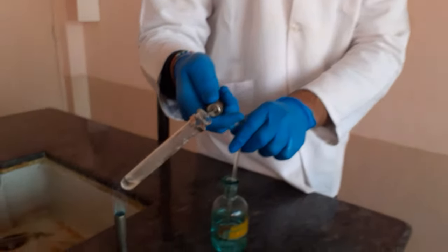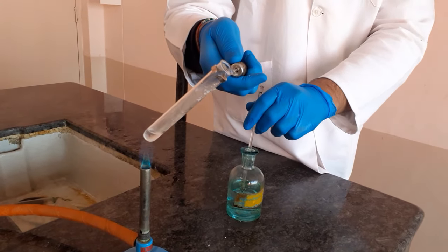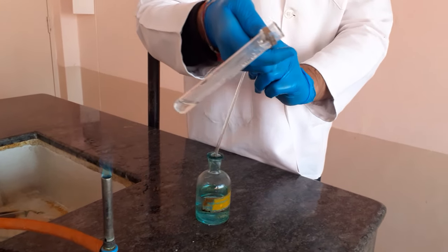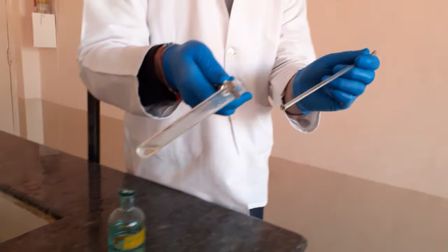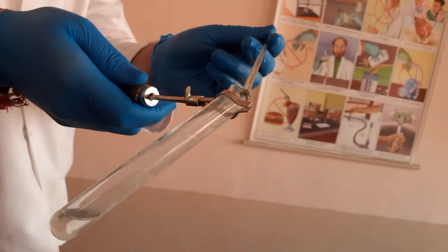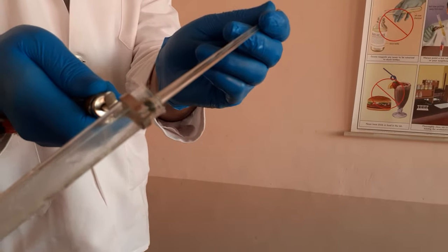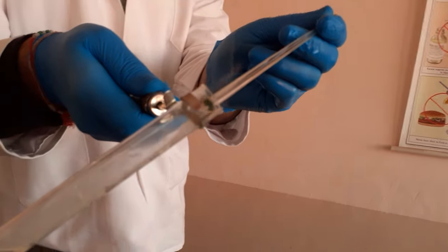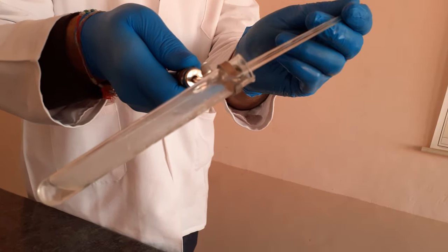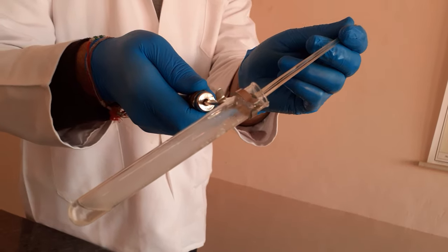He will just warm it a bit so that there is evolution of the ammonia gas, if at all. Now we will bring a glass rod dipped in concentrated HCl near the mouth of this tube. There is a dense white fuming formed inside the test tube, which indicates that there is a probability of ammonium ion.